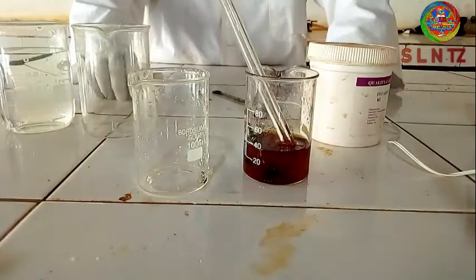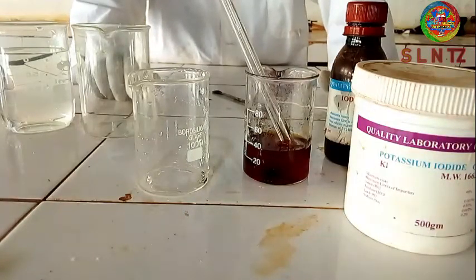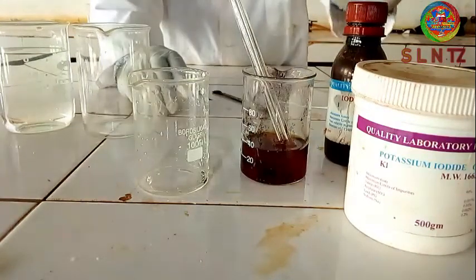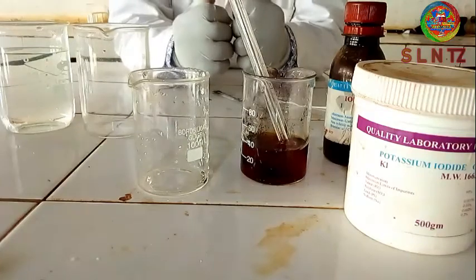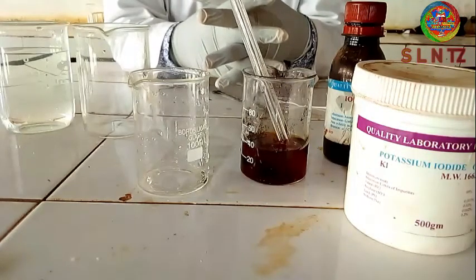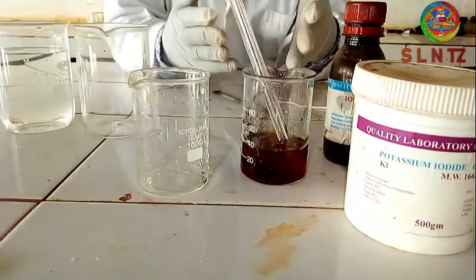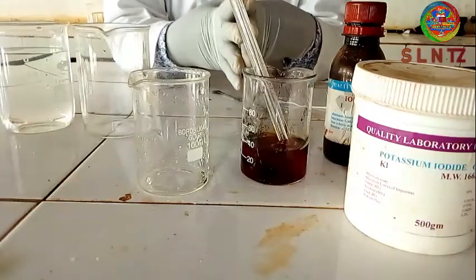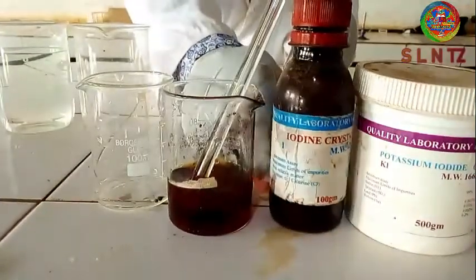To remind you: the first thing you have to prepare is potassium iodide, then iodine crystals, then water. First, prepare the potassium iodide solution by dissolving potassium iodide in water. Then take the iodine crystals and put them into the potassium iodide solution — and now you will have iodine solution. That is the answer to the question you have always been asking: how to dissolve iodine crystals, because they don't dissolve in plain water.